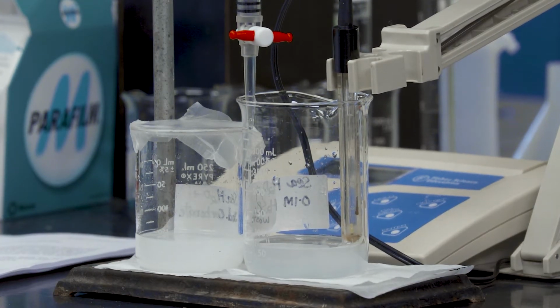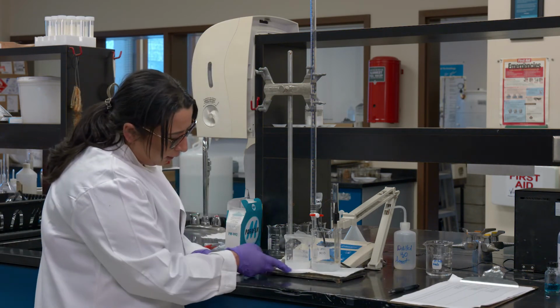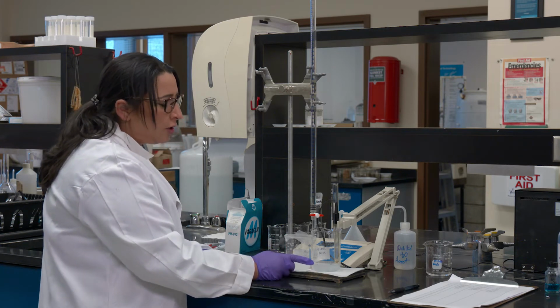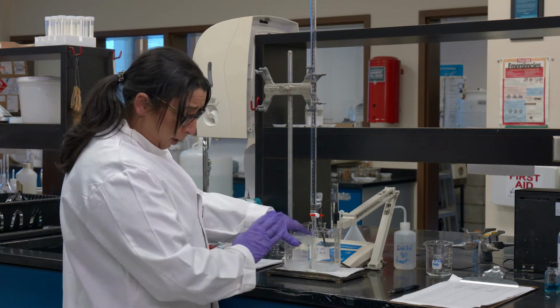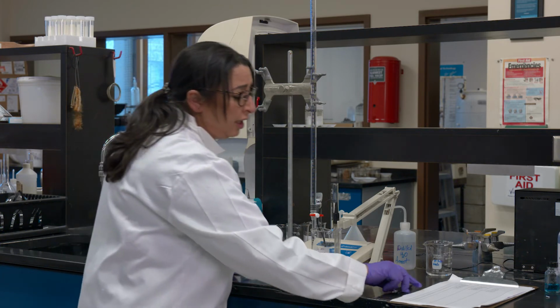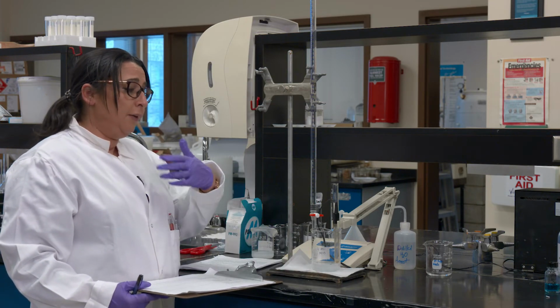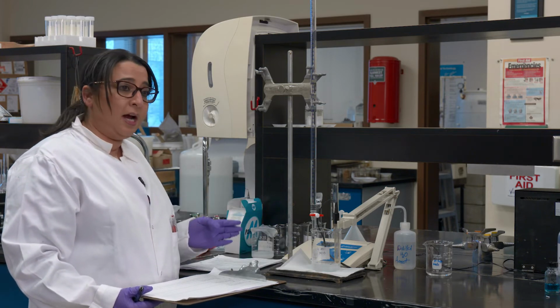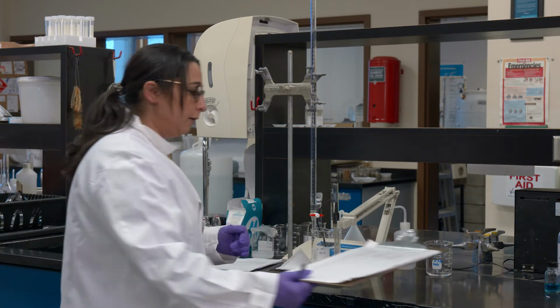So the solution has changed dramatically in terms of color. This was the initial solution, and by the time I hit 9.09, starting from 9.91, this is how it looks. And this is not where our endpoint is. I still have to add more because this should become more clear. And by the way, remember we started with the carbonate, so we started this equation the other way around, where you have carbonate, and that's why it was cloudy, and by the time it's more acidic, close to 3, you will see some CO2 and some bubbles in the solution as well.